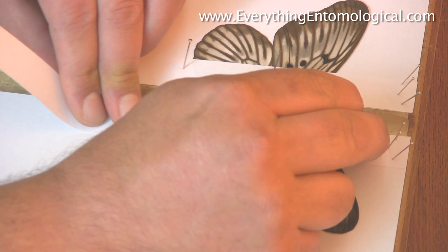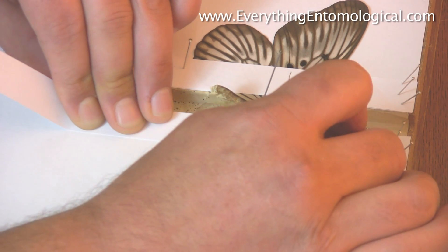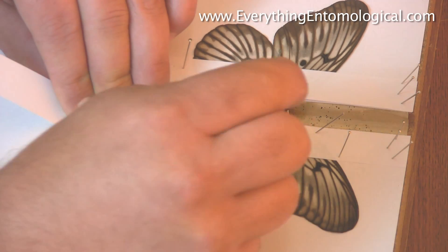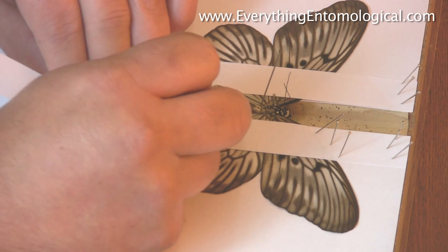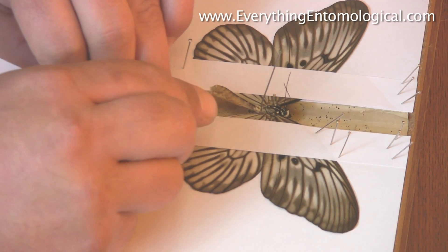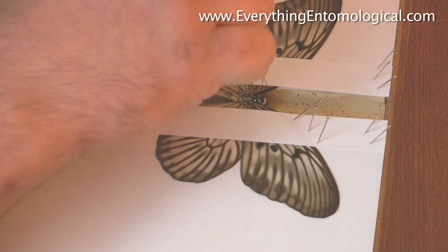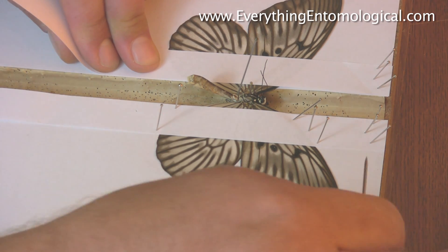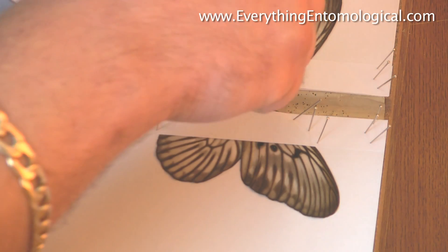When you're happy, pin — keeping this setting strip pulled tight. Two pins at the top, and if your wing persists to move just put another one there, not in the wing, then one at the bottom and one at the top. This is all done by eyesight mainly. This board does have lines on it — you can do wings to the tops of the lines so you get an equal amount on either side. Take this pin away and push.